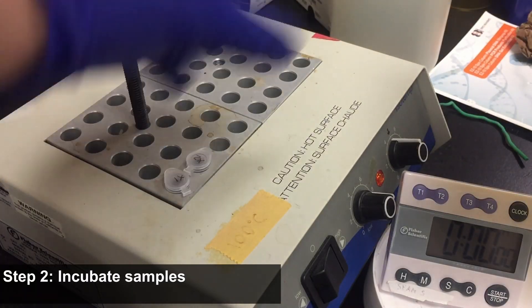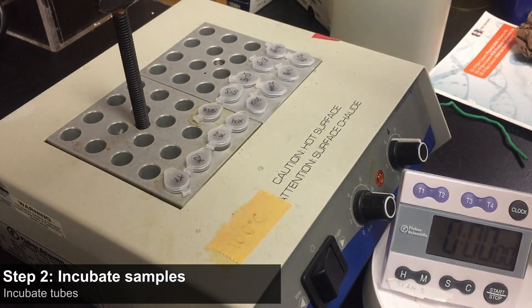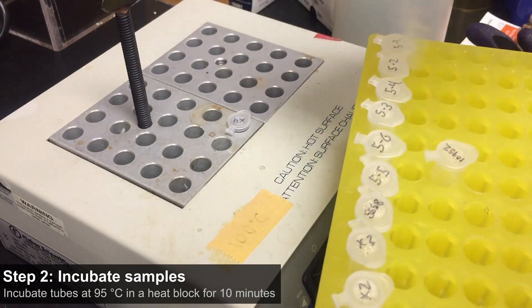Step 2: Incubate samples. Incubate tubes at 95 degrees Celsius in a heat block for 10 minutes.